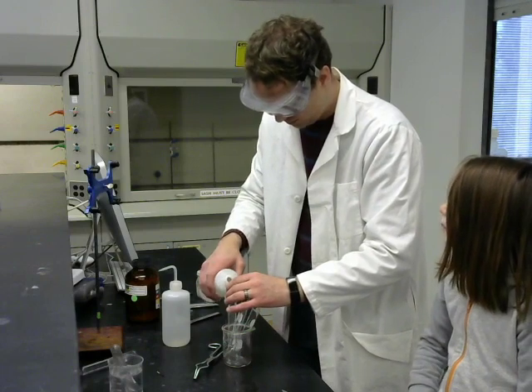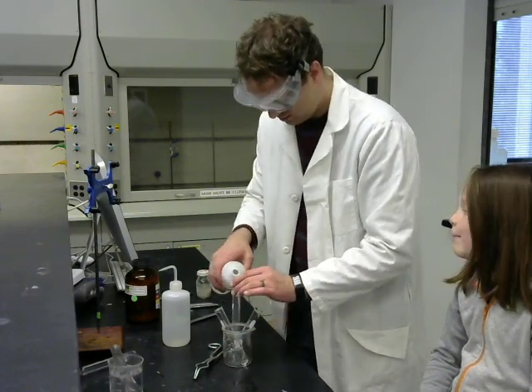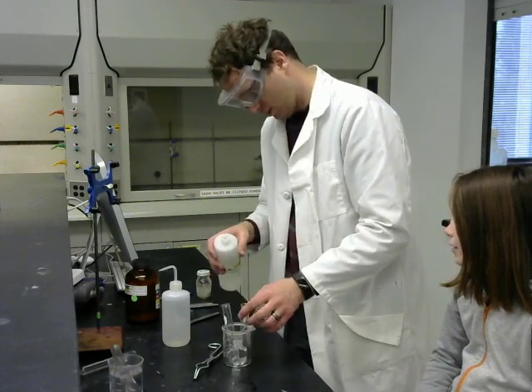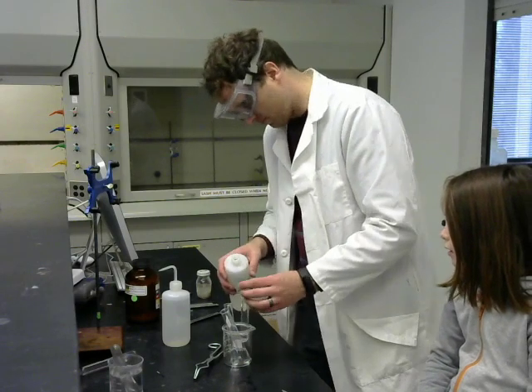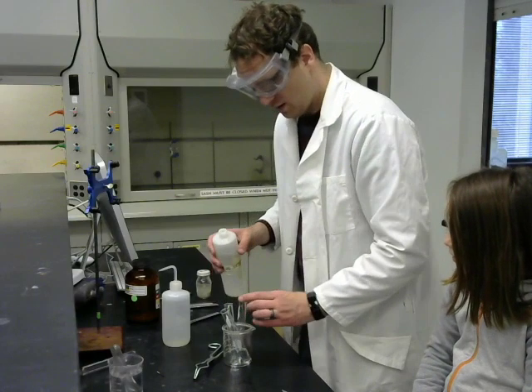No, why don't you let me do this? Okay. But I don't know how to pour a milk gallon. You can pour a glass of milk like a pro, but hydrochloric acid maybe will let me handle that. Yeah, I think it's also because you need a certain amount.